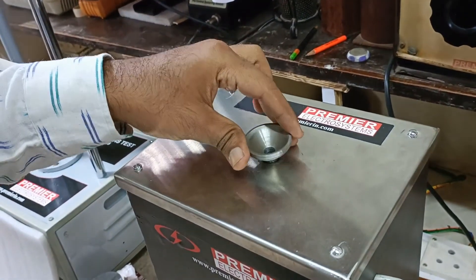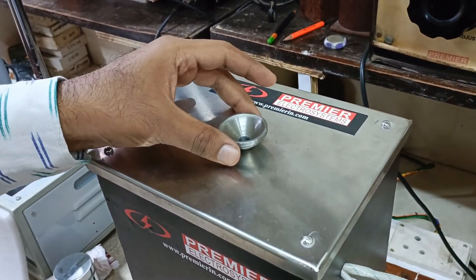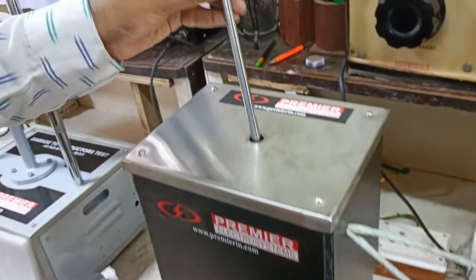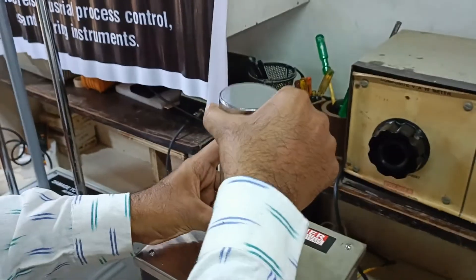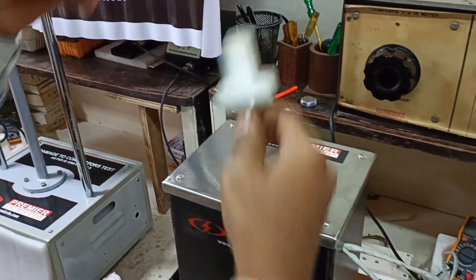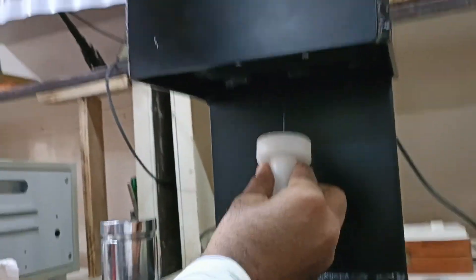To charge the material we have to use this funnel. You can put the plastic pieces easily inside the metal rod. After that you can use this charging piston with the weight specified to do the compression of the material. We also give the nozzle to clean the fixture from the bottom.